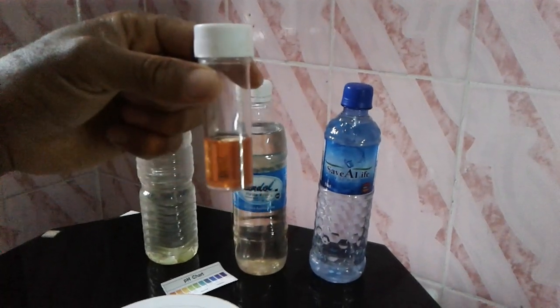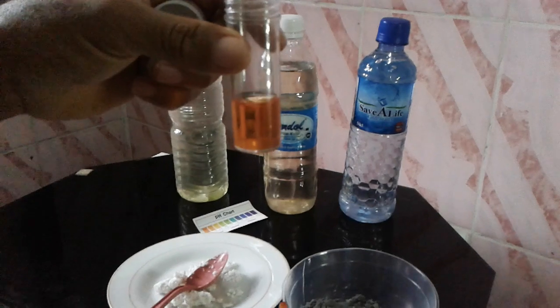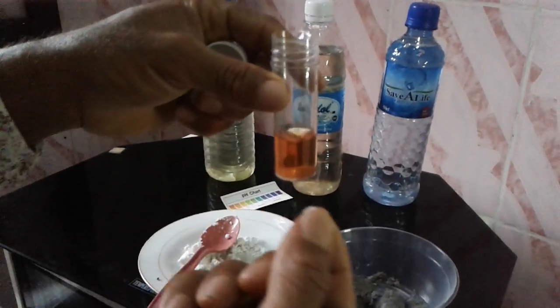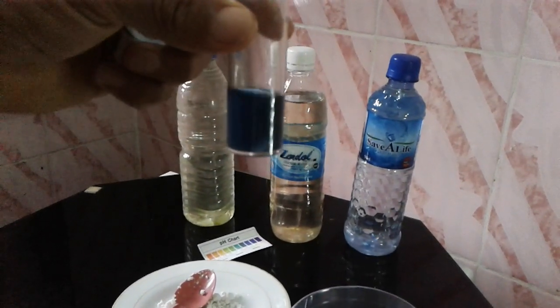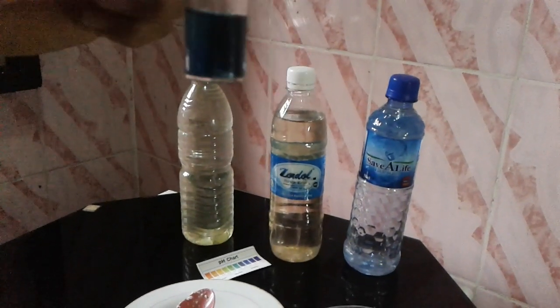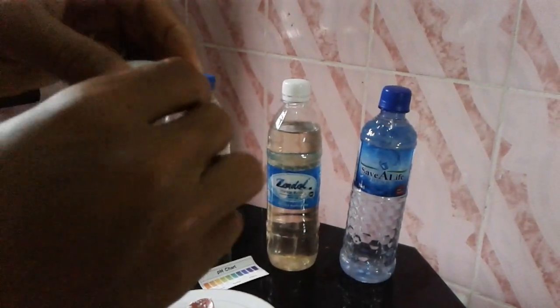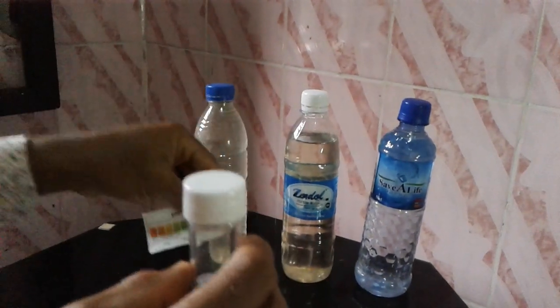If you wanted to use this water for your fish, what you'd need to do is apply a little sodium bicarbonate. I'm going to pick some with my hand — it's not corrosive — and drop it inside. Notice the quantity I dropped was too much, which is why it has turned the water alkaline. If you take this to the pH chart, you'll see it is pH 9, which is also not good for your fish.